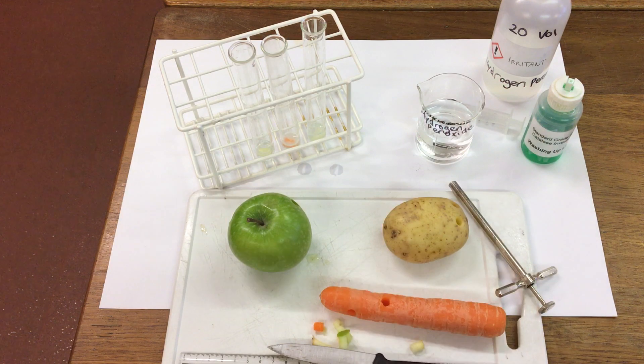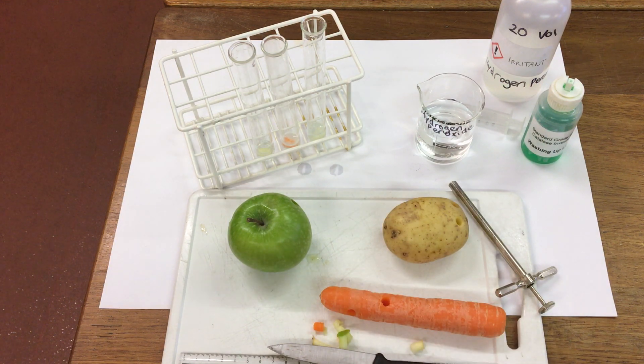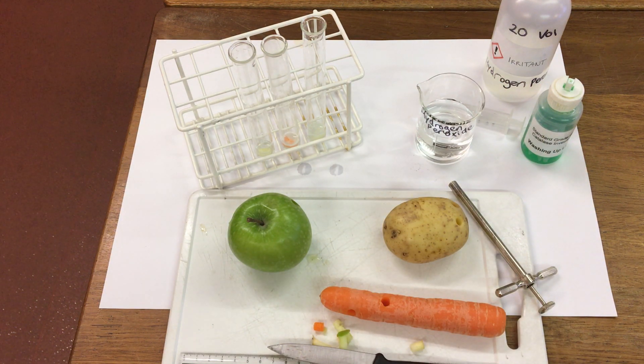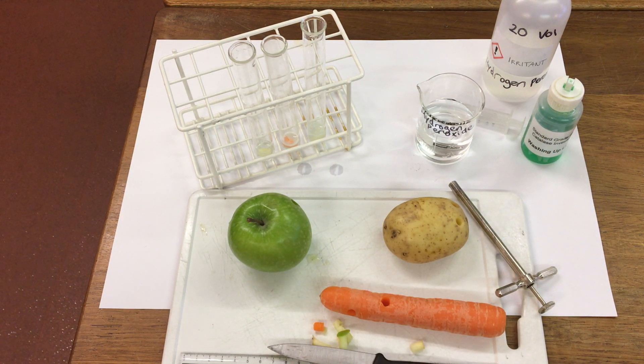We're going to leave this for an amount of time, and then we're going to come back and we're going to measure the height of the foam produced.